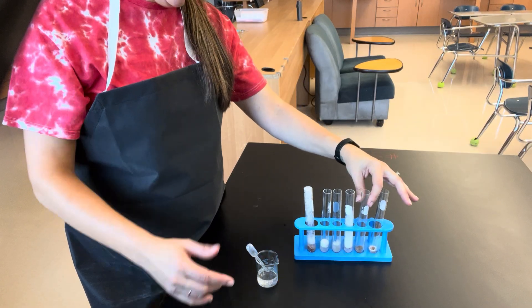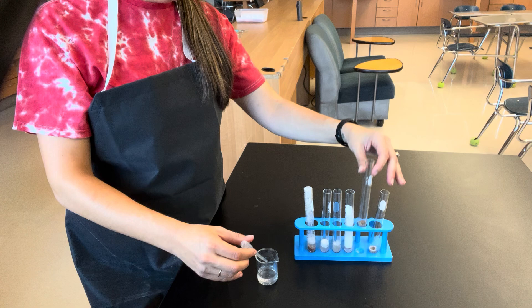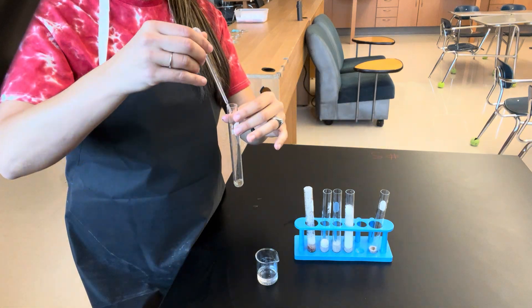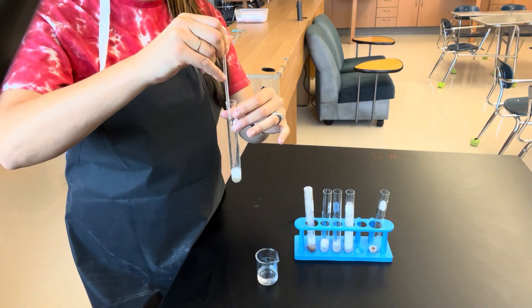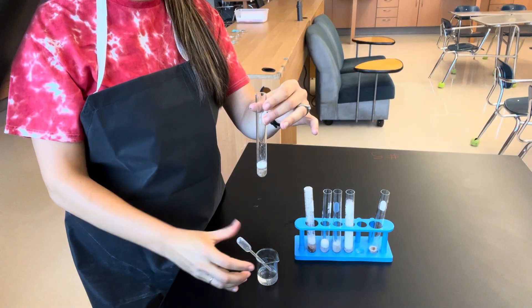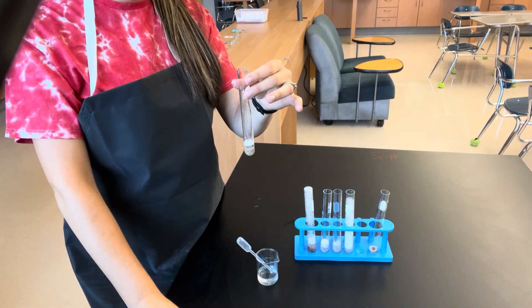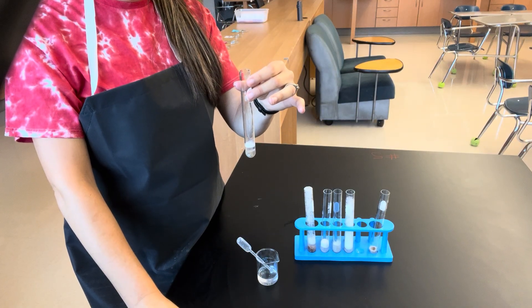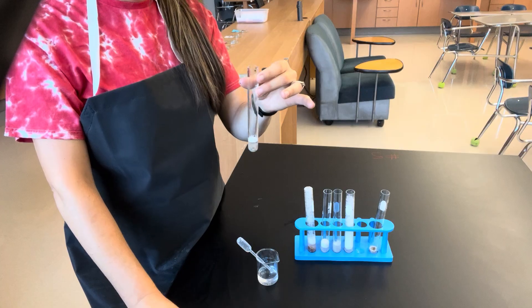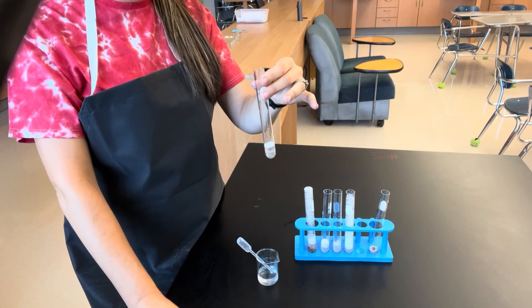Next, we have our low pH liver. This has been soaked in an acid. We do see some reaction here.